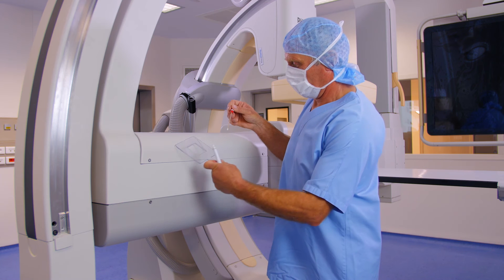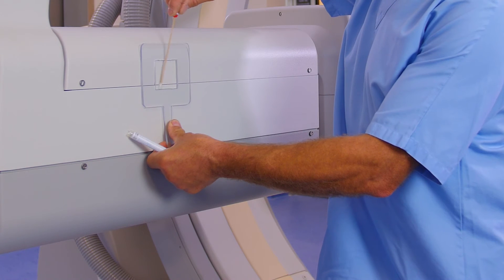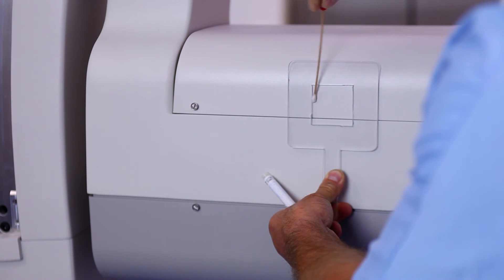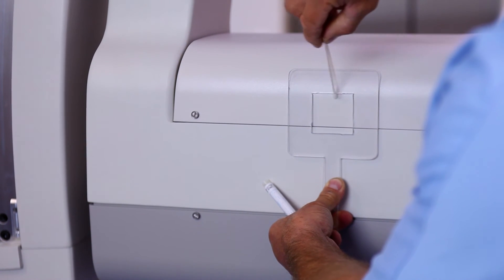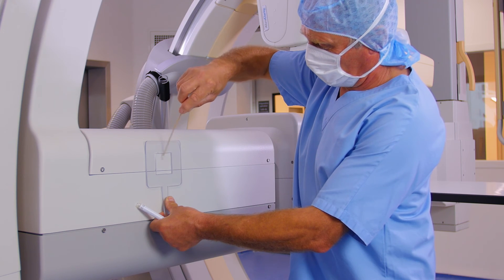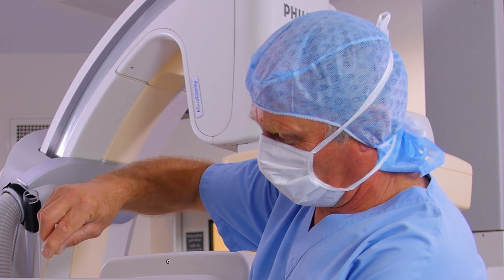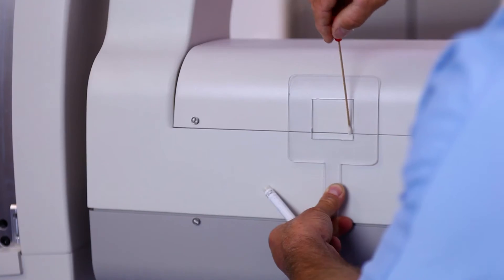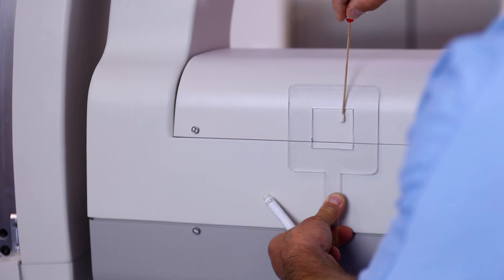Operate close parallel ribs with the swab on the sampling area, rotating the swab gently as you go. We recommend you maintain a 45-degree angle, constant pressure, and that you sweep the area following the technique defined by the NFEN ISO norm 14698-1. Then repeat the sampling of the same area, drawing perpendicular ribs.